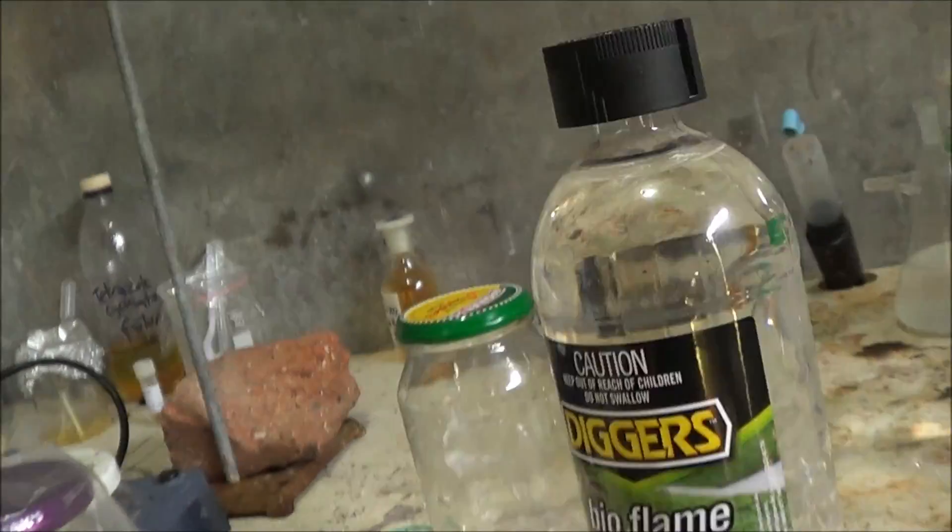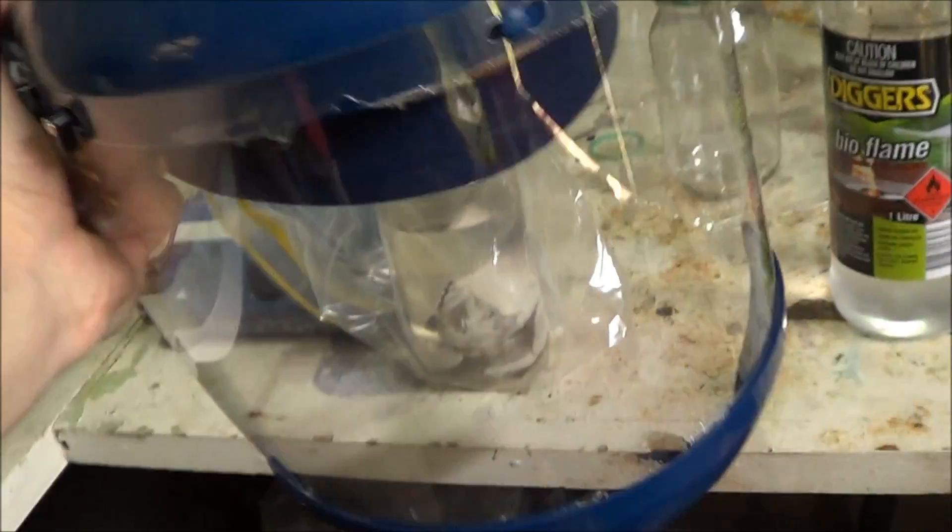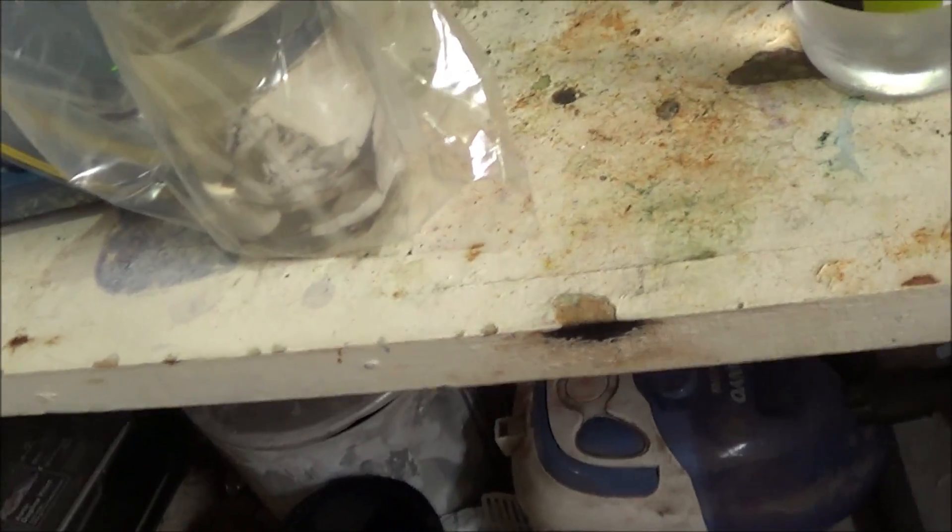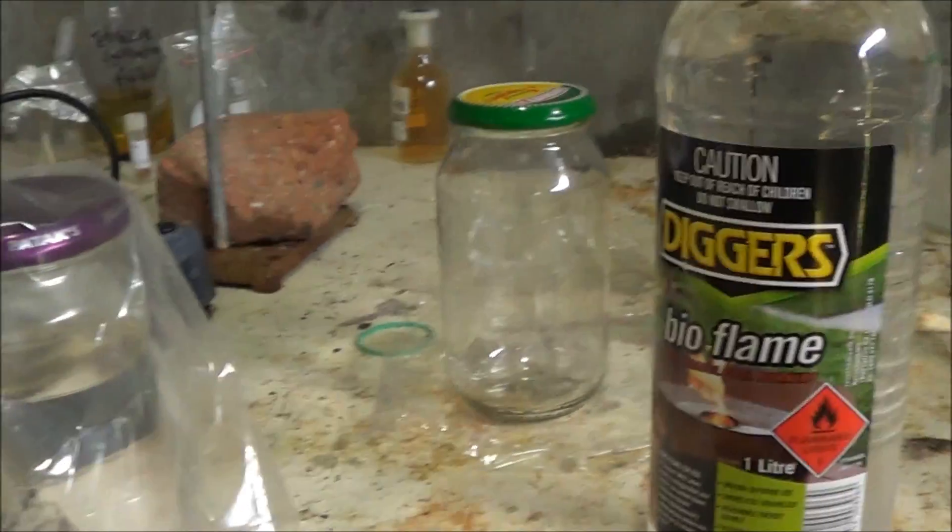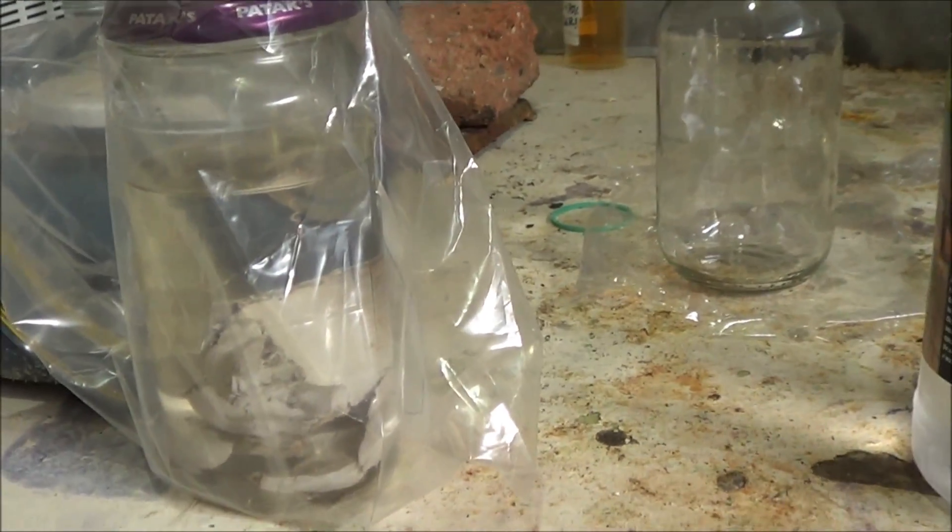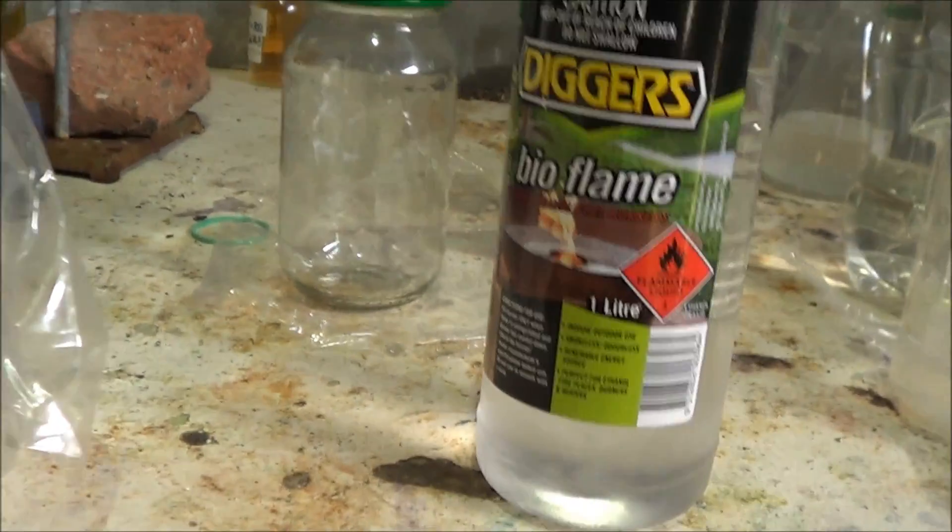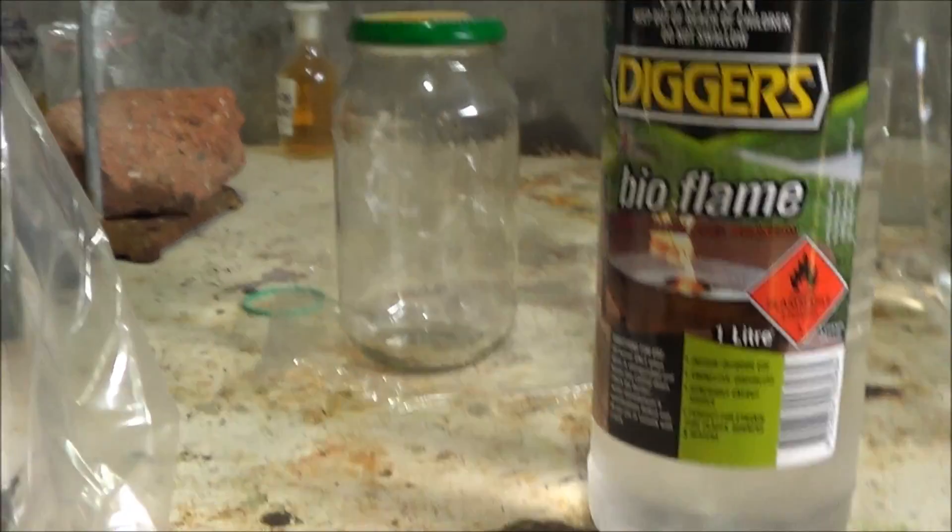And this also gives me the opportunity to wear my face shield which I picked up today as well. Because there's a chance this could be quite violent. We're going to be adding small amounts of sodium pretty slowly and we'll cool this right down. Because we don't want this bursting into flames. It's very flammable. I mean if it bursts into flames it would be difficult to put out. And because the sodium will be on fire it would be a bit of a mess.